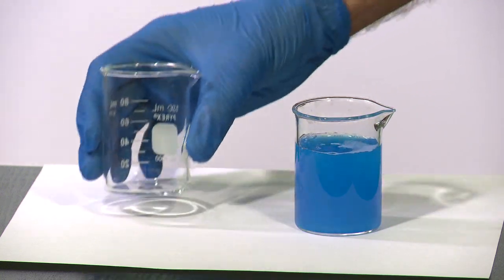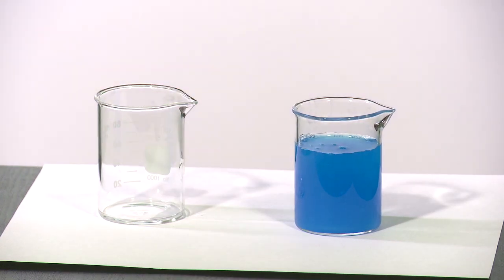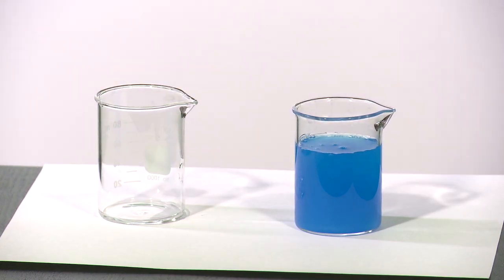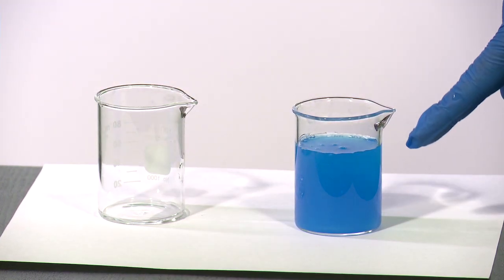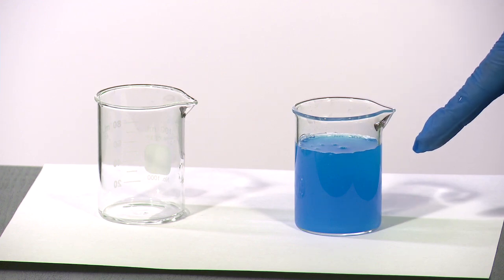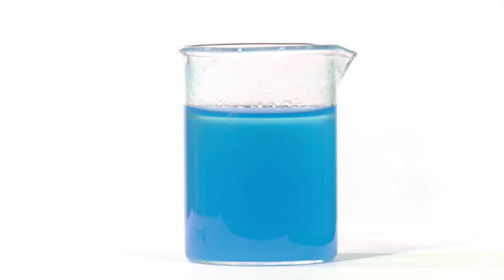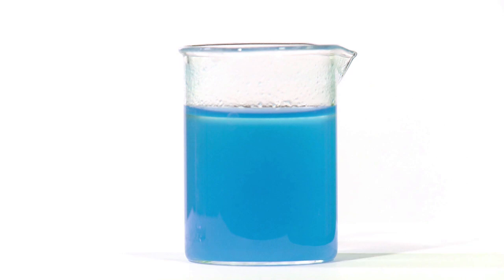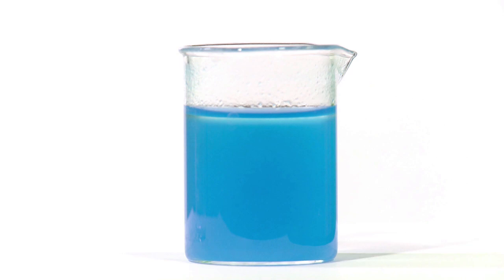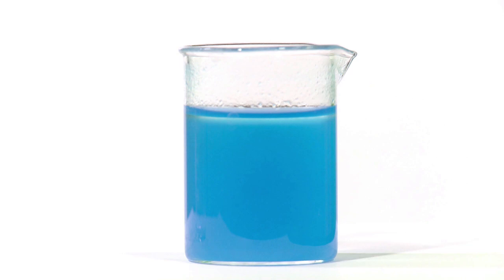Look at that. Beautiful darker blue. At the same time, you see the solution is no longer clear. And that is because a solid, insoluble substance has formed. We call this the precipitate.